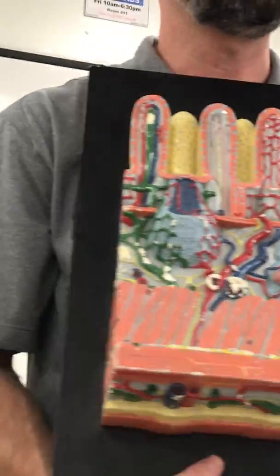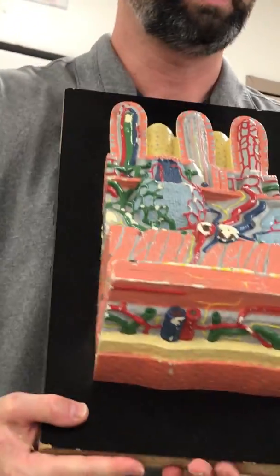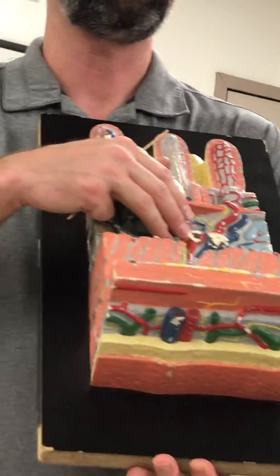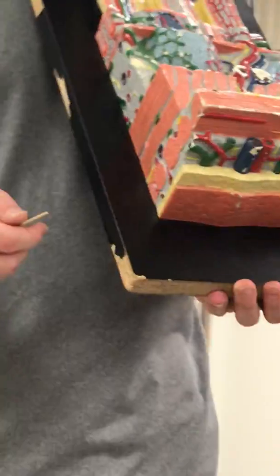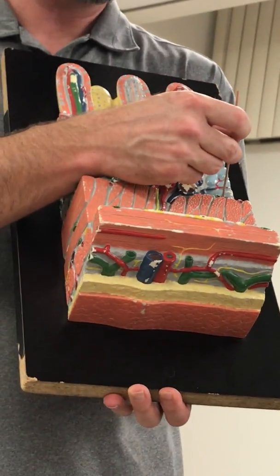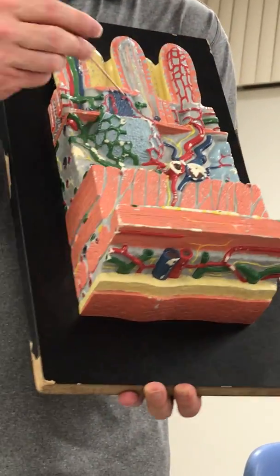Now, you only have those in the duodenum, and this is meant to show small intestine, and you know that because there's villi at the top, right? However, if this really was duodenum, there would be no serosa. So they're not trying to use this to show the duodenum or the jejunum-ileum, just a general representation of features of small intestine. But that alone would mean duodenum, and if we didn't see these submucosal glands, but we did see the serous membrane, then it would be jejunum and ileum. This thing here?